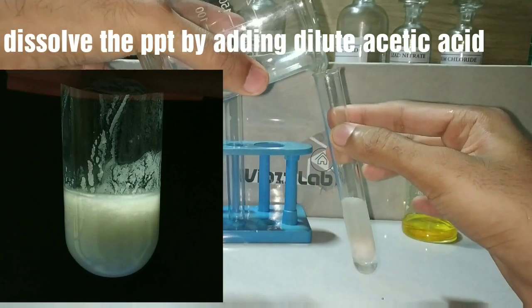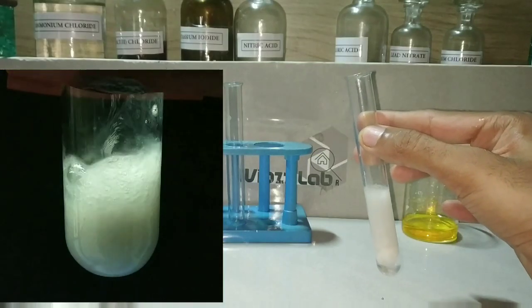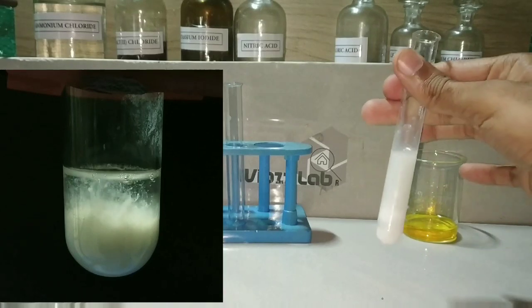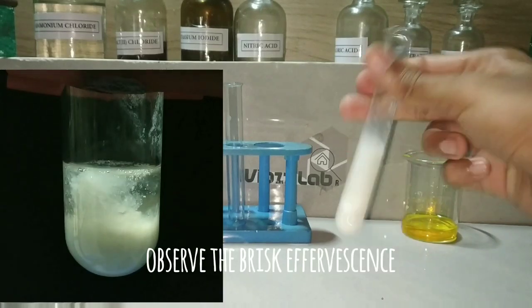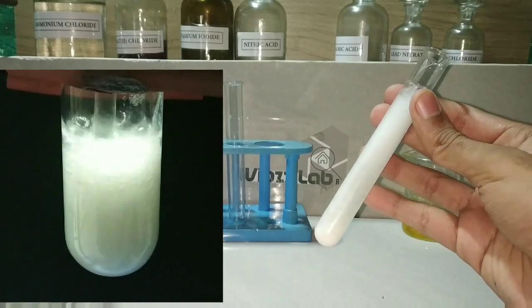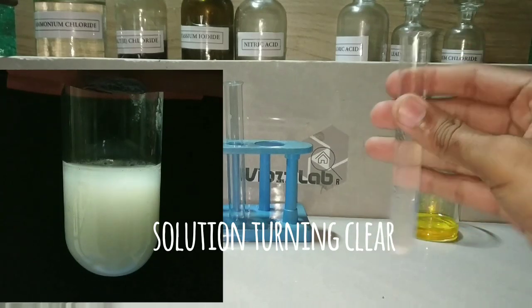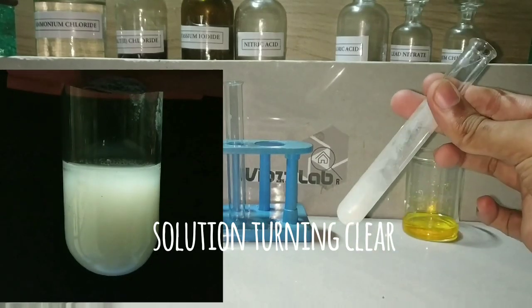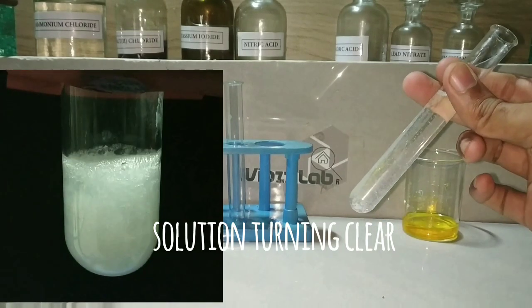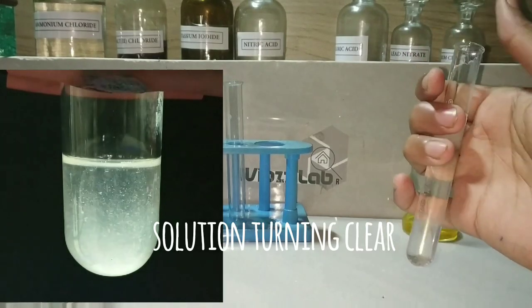Now we will dissolve this precipitate by adding dilute acetic acid. On adding the acetic acid, you can observe a brisk effervescence and the precipitate starts to dissolve. The solution has now become clear.